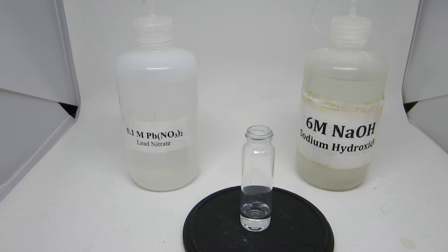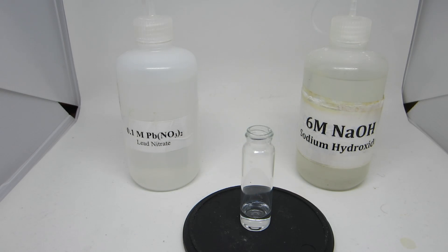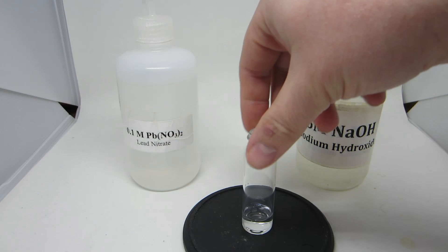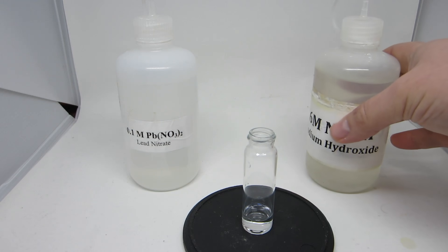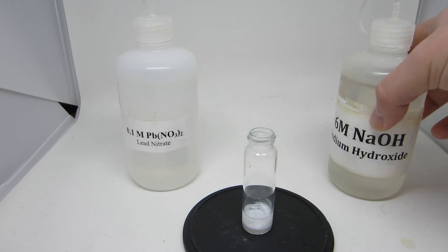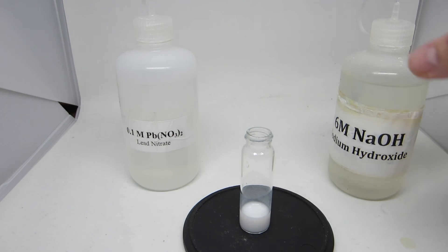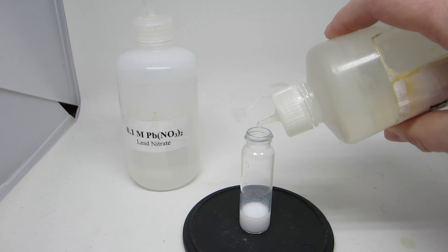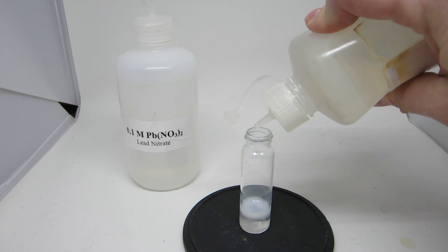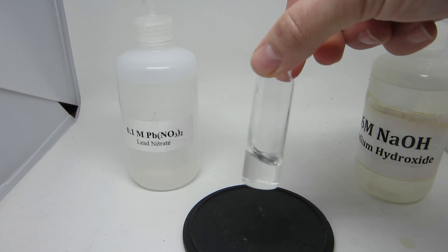The tenth reaction looks at the complexing of lead and hydroxide ions. Clear and colorless lead nitrate is reacted with sodium hydroxide. Upon initial reaction, there is the formation of a white precipitate. In the second step, by continuing to add sodium hydroxide, the precipitate slowly dissolves and in the end results in a clear and colorless solution.